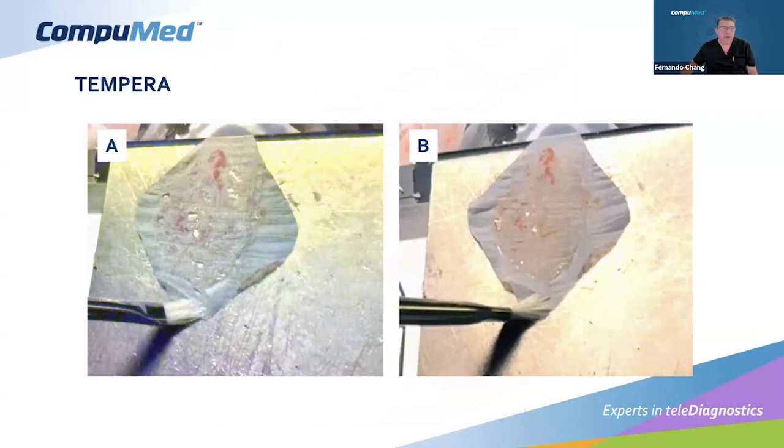And now we have another example of how the temperature actually changed everything. On the left, in picture A, we have little holes around the sample. As we introduce heat to the sample, immediately this transfer of heat melts the ice crystal formation. And now in picture B, the same section, with some heat applied, you don't see the same problem. That's why it's important to manage and practice this so we get the right temperature.